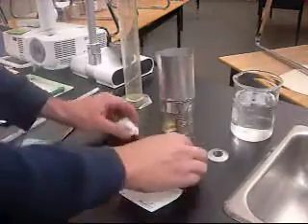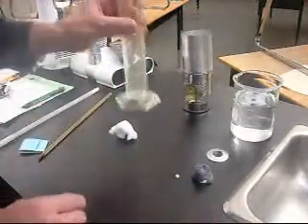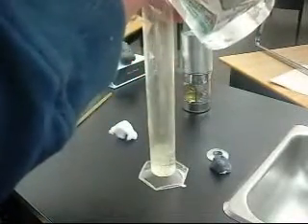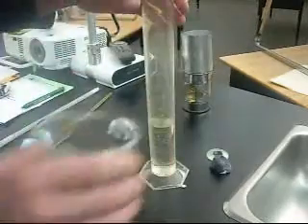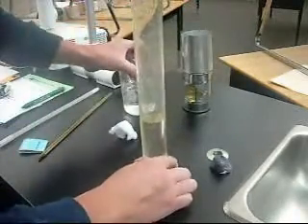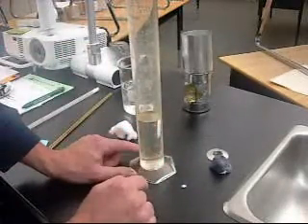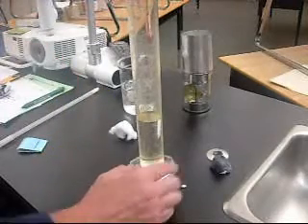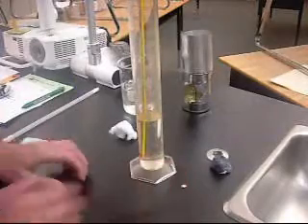Okay, so next let me show you the procedures that you're going to be doing for this. First, you're going to want to measure out 100 milliliters of water. Remember the meniscus. The meniscus is that curved surface of the water. You want to make sure that when you measure your 100 milliliters, the bottom of the curve comes down to the 100 milliliters. You're first going to start out with your initial water temperature. Place your thermometer in, and you might have to let it set.